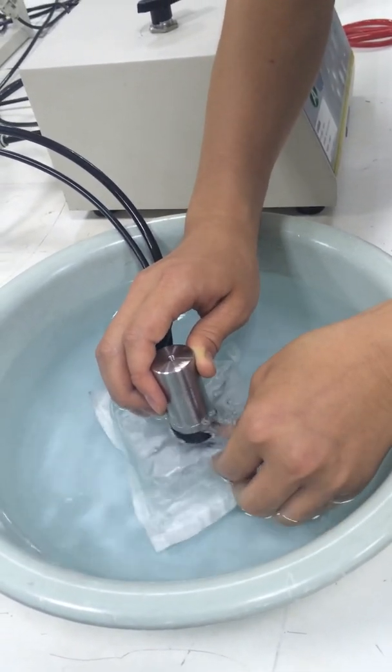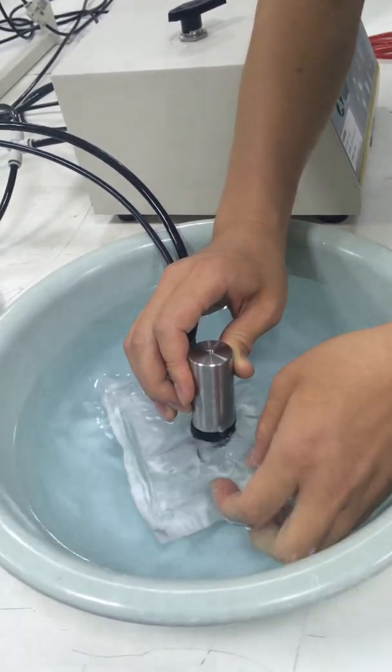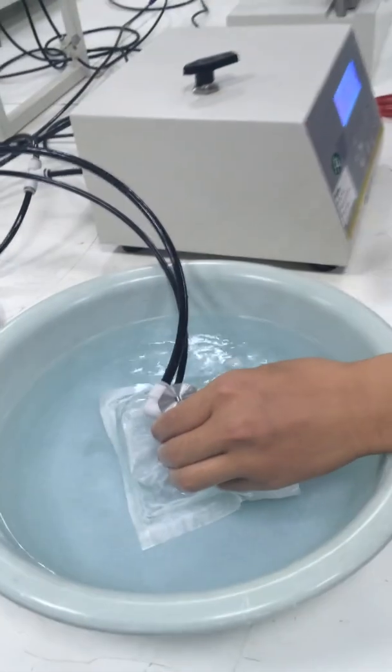In this one, let's use a micro button. We don't need to use a micro button another time.